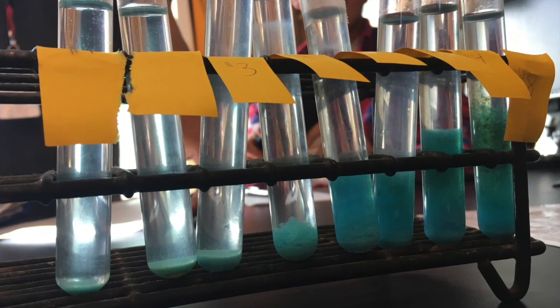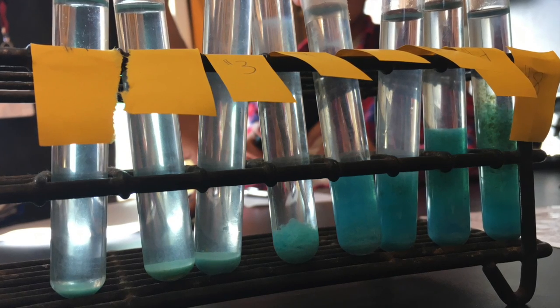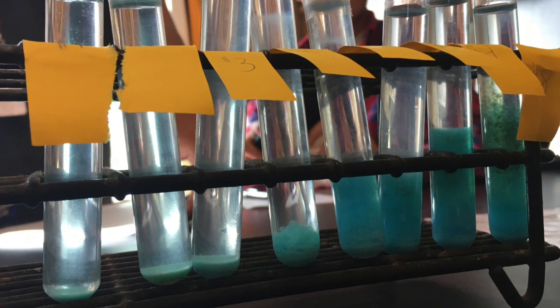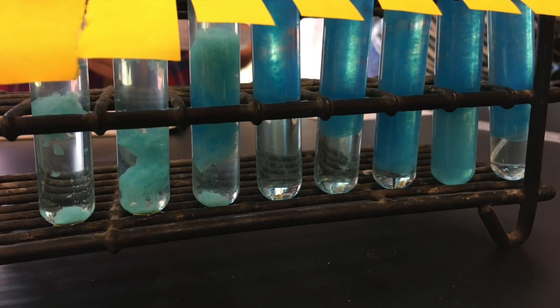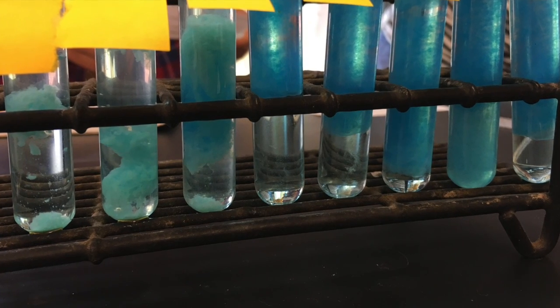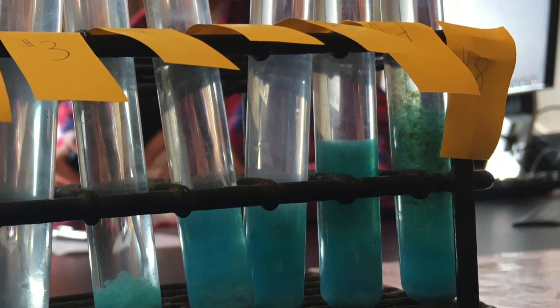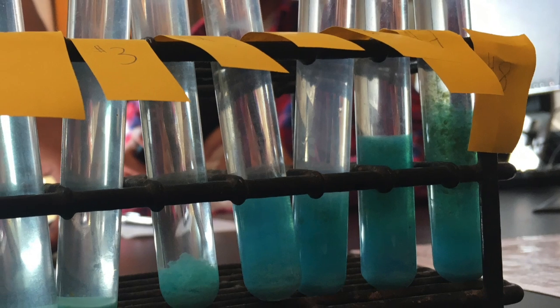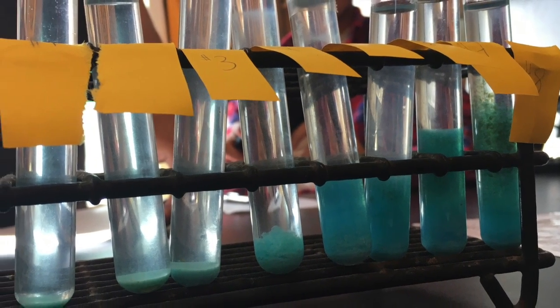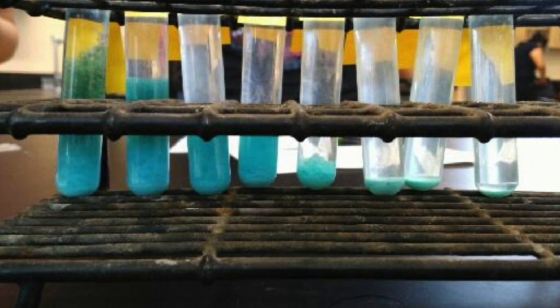For each test tube, we calculated 0.2 moles over 1 liter times the total number of liters that the test tube has. By doing those calculations for each test, we noticed that the ratio was 2 to 1. Finally, due to test tube 5 having a perfect ratio, every other tube after it would have an excess of KOH, which makes CuSO4 the limiting reactant. And in this case, all the tests after 5 stayed constant and had the same precipitation.